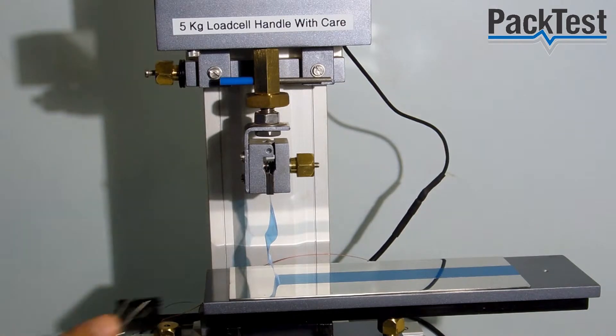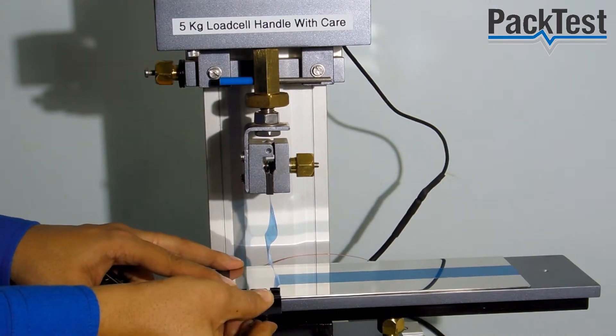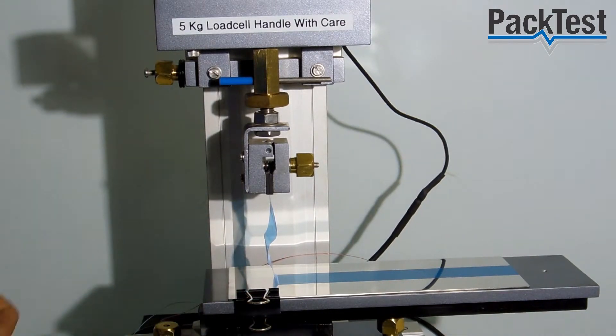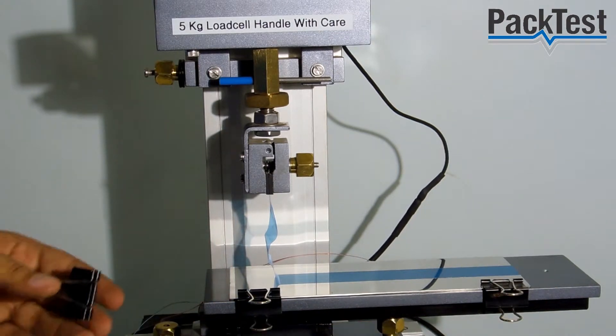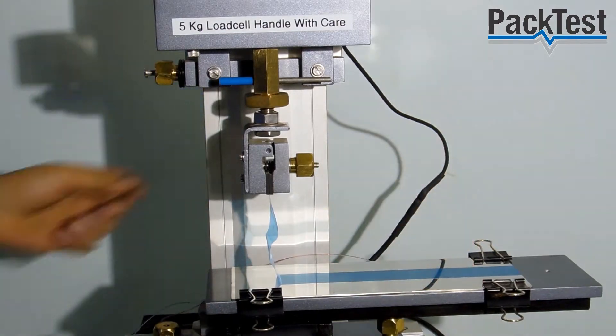Use clips to hold the metal plate in place.